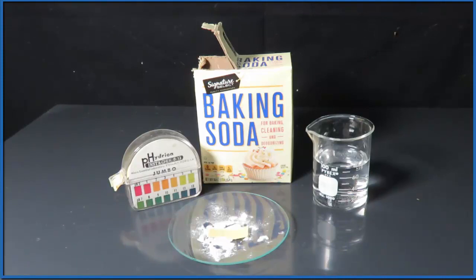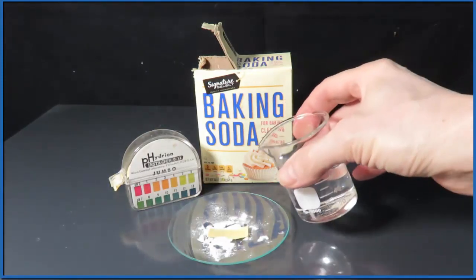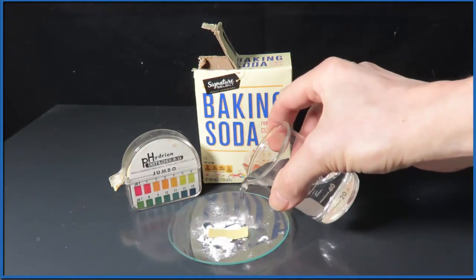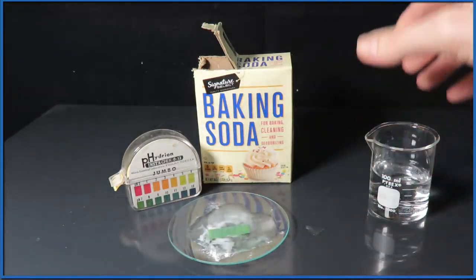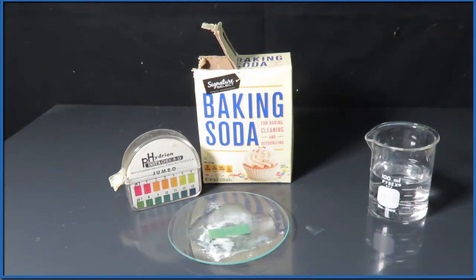If I put the pH paper right in with the baking soda, nothing happens. We've got to mix some water in to get the reaction started. So we're putting distilled water here.